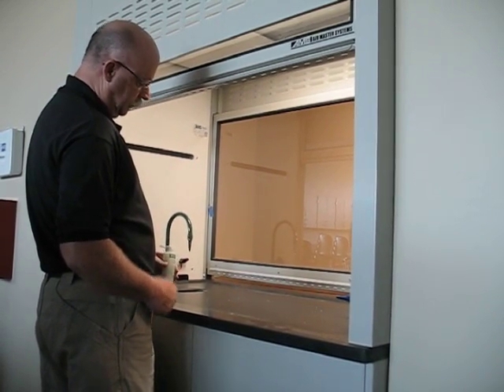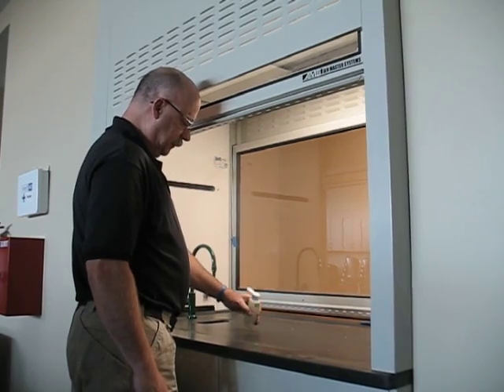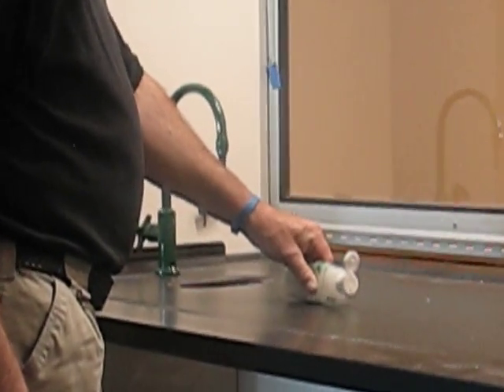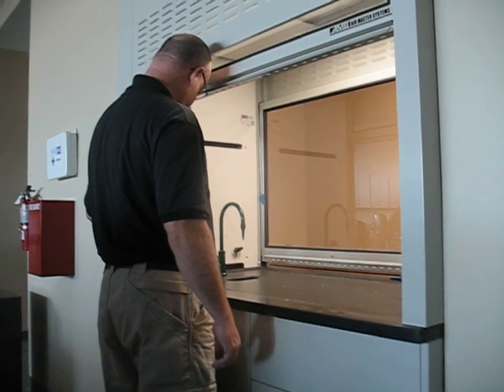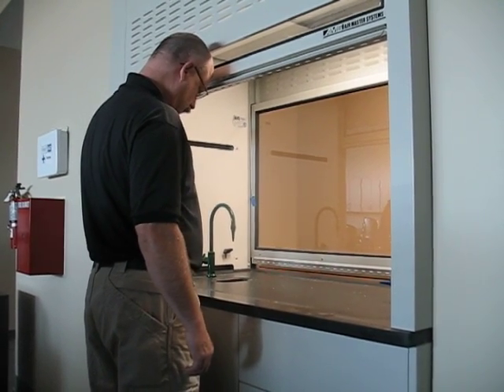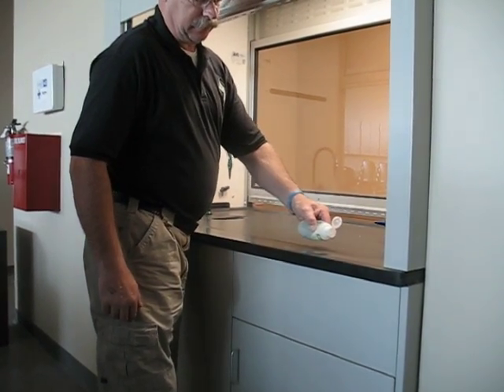I don't know if it's showing up on the video, but the ventilation fume is actually coming up into my face. It's occurring deep into the hood as well. You can see that the fume is actually moving from the floor directly into the user space. And we have complete reversal with loss along the bottom of the laboratory fume hood.